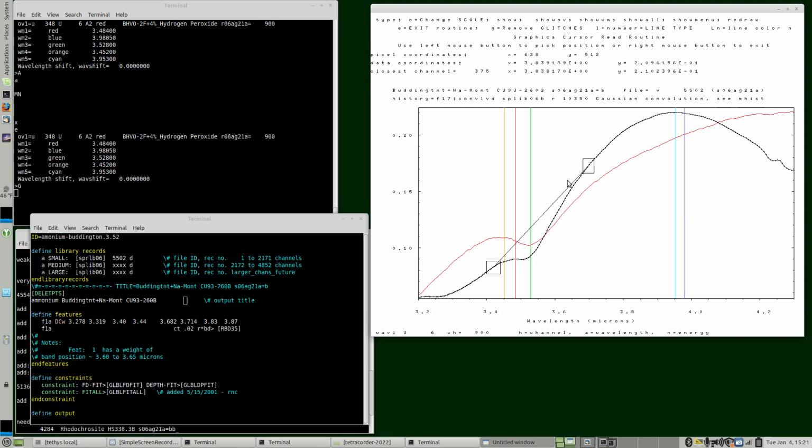And if I'm drawing a continuum, yeah, that would be something like I would do. And then the shorter wavelength, 3.278, so around 3.31 or so. 3.31, somewhere in there. That looks reasonable. So these continuum points, while they worked for peroxide, they also work for this ammonium sample. So we can go with that.